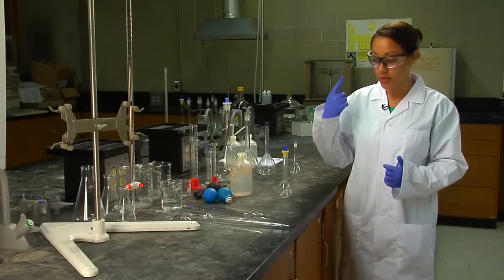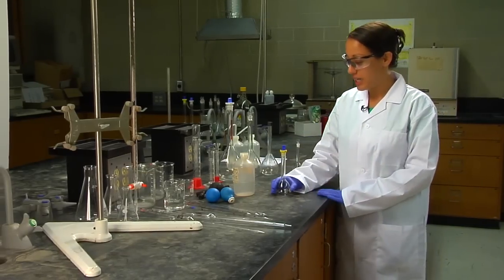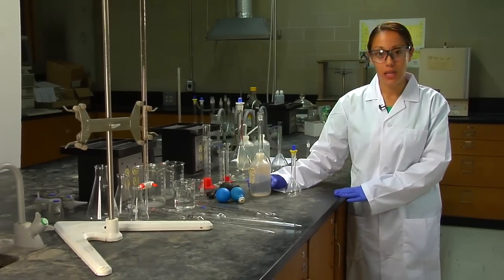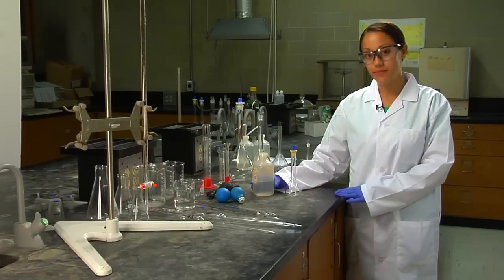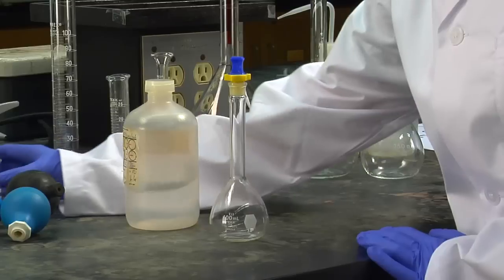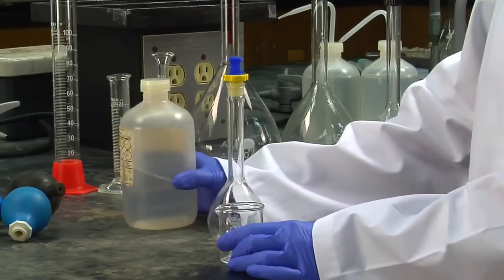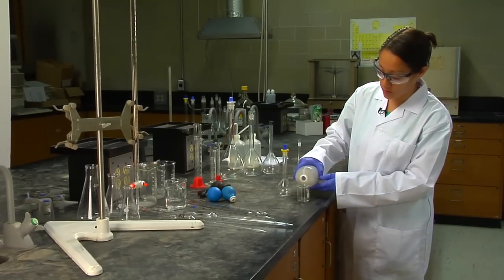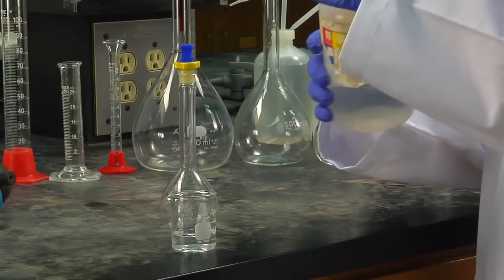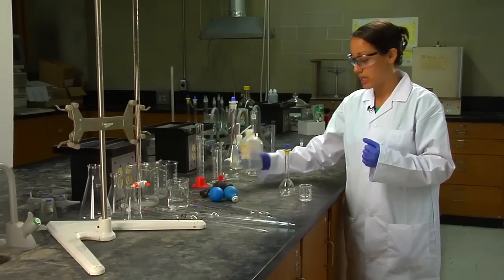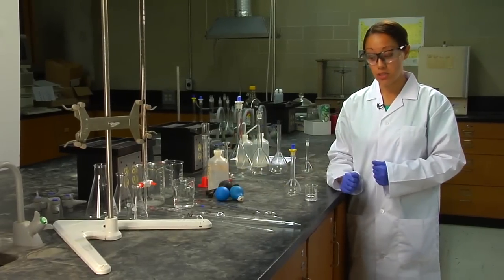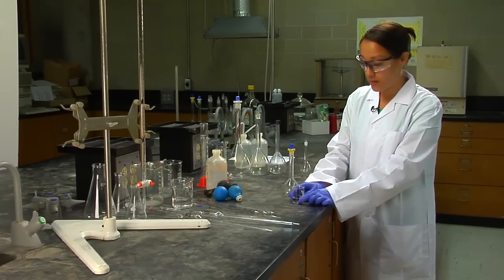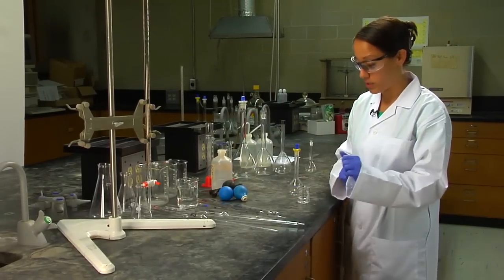Now that you have your gloves, make sure you have your safety goggles on and we're going to make a very simple dilution. Make sure you grab a beaker because you're never going to pipette out of the stock solution ever, because if you do you're contaminating the stock solution and that affects everybody else who uses that solution. So let's be fair and just use a simple beaker that you've cleaned.